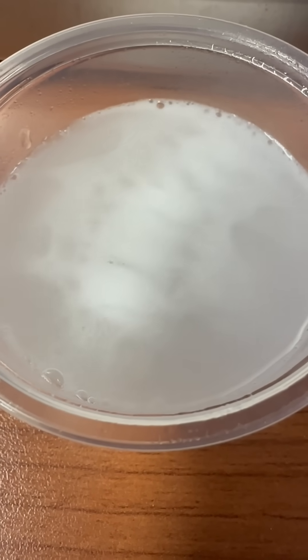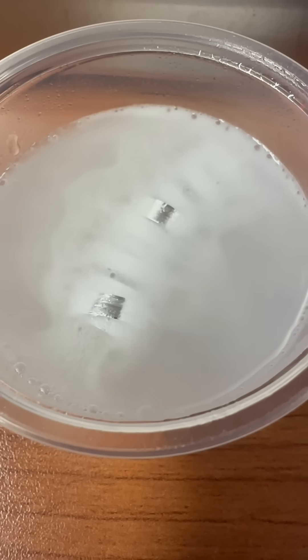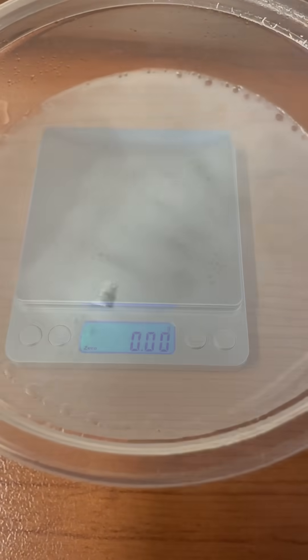This is a strip of metal dissolving in some acid. Hey, let's collect some data while running this experiment, and then I'll give you a chemistry challenge to solve.